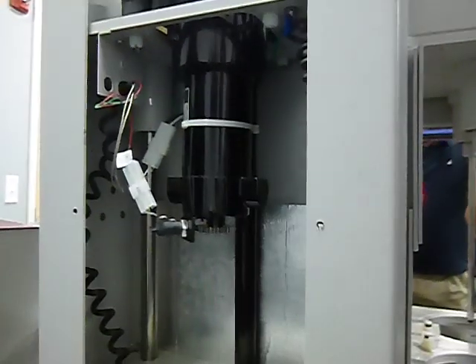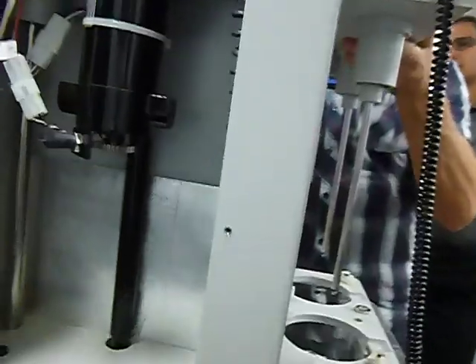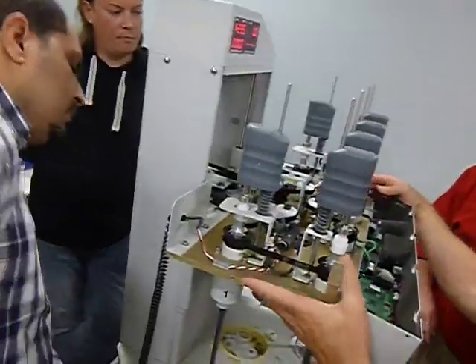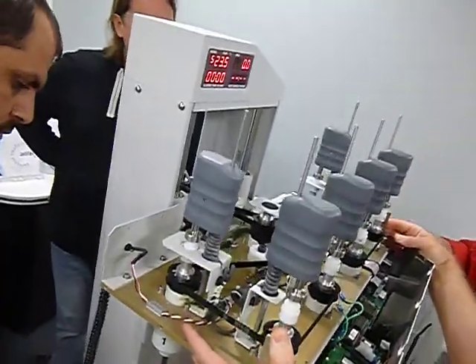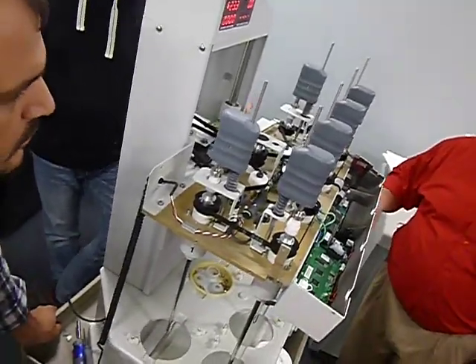If it slams down, if I push the brake in here and it bounces down, it needs to be replaced. So I've seen just that it doesn't hold it. It should come down a little bit, but it should hold it right about in the middle. The middle area is where it usually ends up holding it about at.